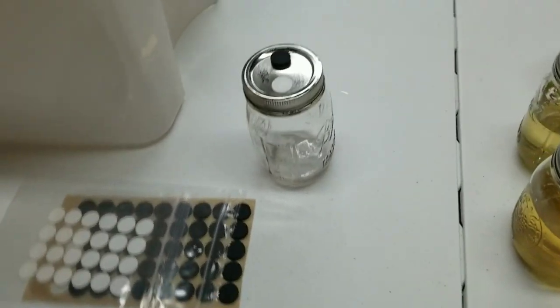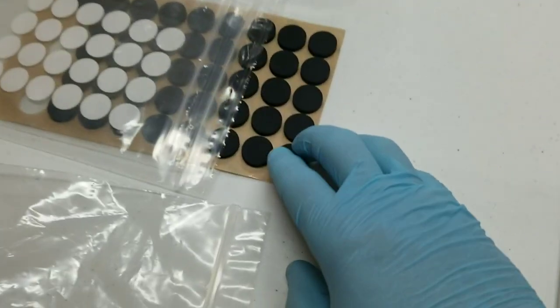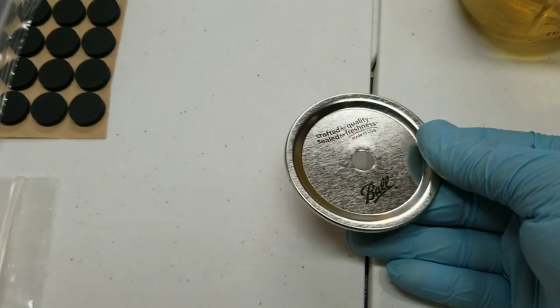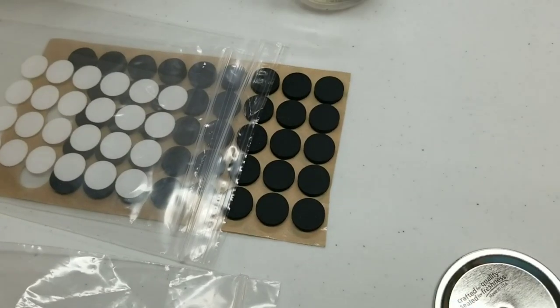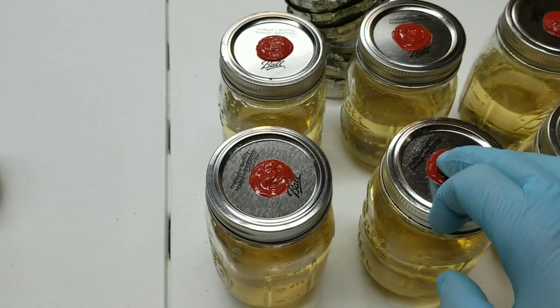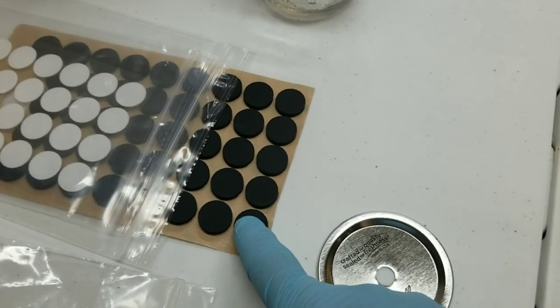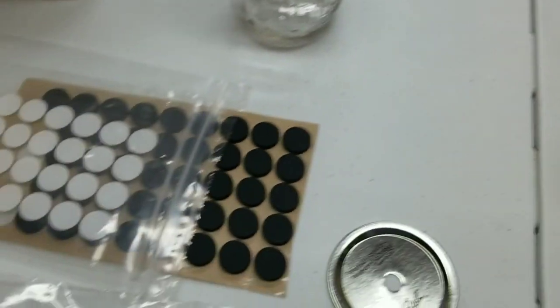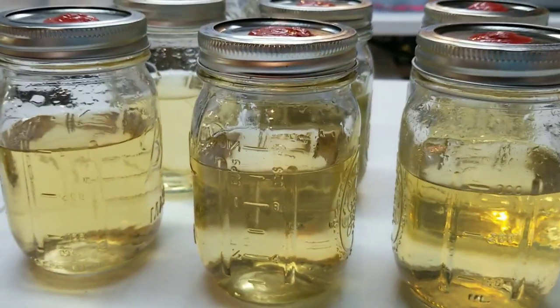The second method, which is even easier if you don't want to use RTV, is using these micropore injection ports. They're self-adhesive — you just peel them off, punch your drill hole in the canning jar lid, and stick them right on. I just started using these this year and I've run them several times and they're still working great. I don't know if they'll last as long as the RTV — you can do hundreds and hundreds of syringes through RTV — but if you don't want to mess with stinky, messy RTV, just go with these.